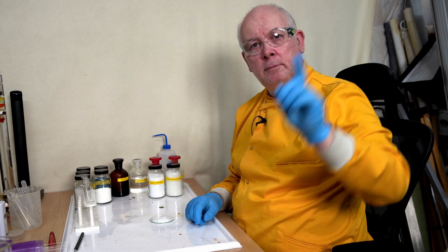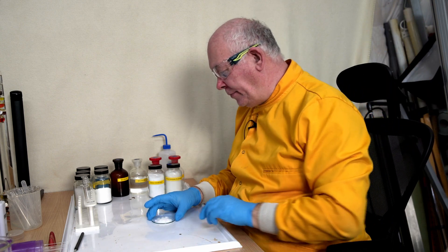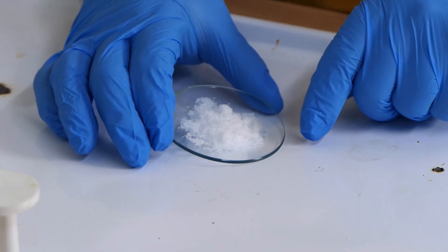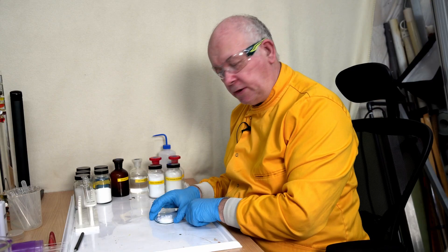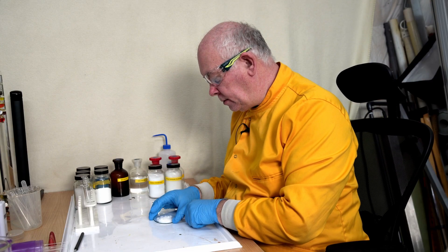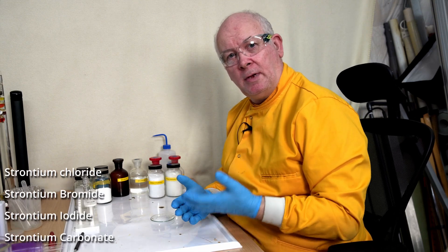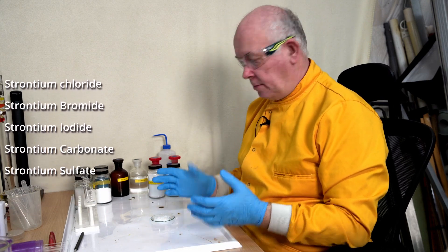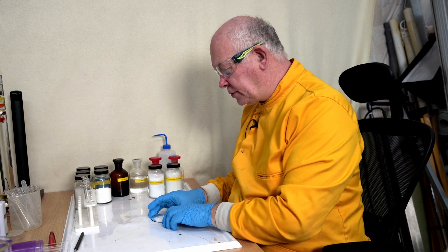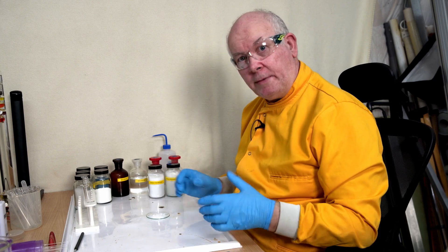In the previous video, which is found up here, you'll see that I've got an unknown substance. By doing lots of flame tests on this, we managed to determine this is strontium. Now I know it's a salt, so it's strontium something — it could be strontium chloride, strontium bromide, strontium iodide, strontium carbonate, or strontium sulfate, but I'm not sure. So what I want to now try and do is perform a series of tests on this substance to see what it might be.